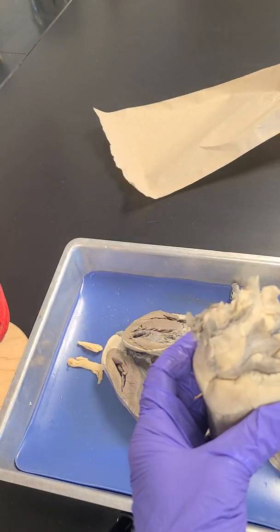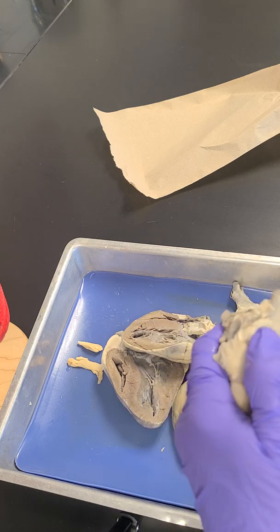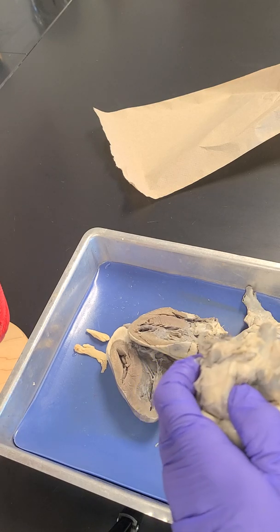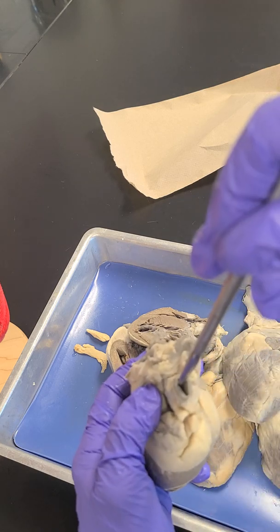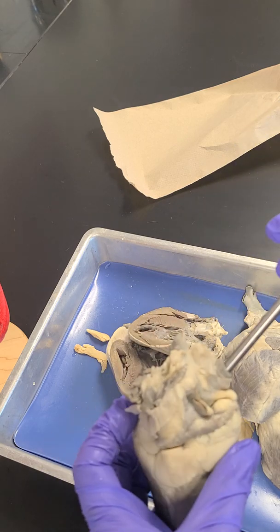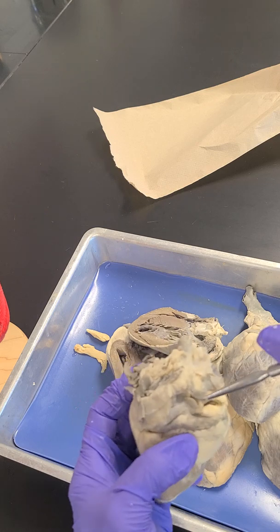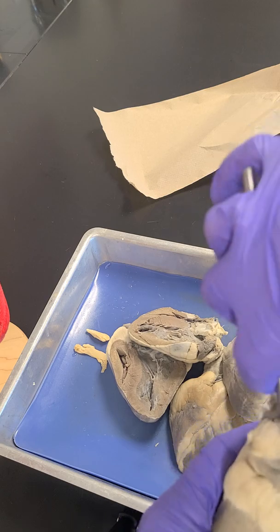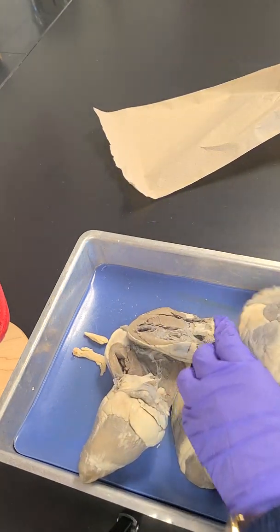On this heart right here, it's this vessel right here that goes deep into the heart. So you can see this side of it. Okay. So that's two vessels. So while we're here, we can go ahead and identify this vessel that goes into this structure right here. Okay. So this is it on this heart.